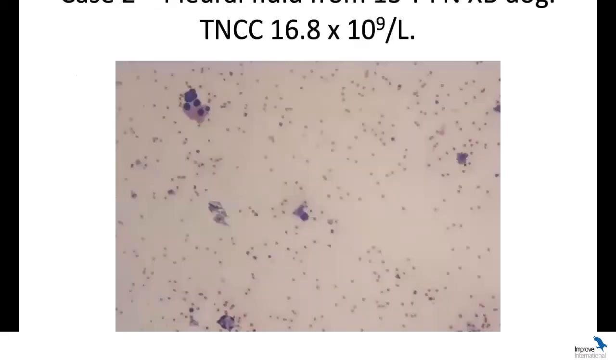Okay. So case number 2 was also a pleural effusion. And in this one, we had the cell count. I forgot to say that in the previous one, we didn't have a cell count because it was flocculent. And when we have flocculent material, pieces or chunks of material within the fluid, we don't want that to get near our hematology analyzer to provide us a cell count, because it may well clog it up and lead to a lot of headaches and time trying to get it back to normal.